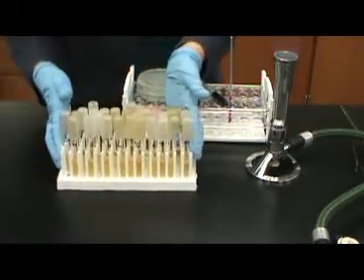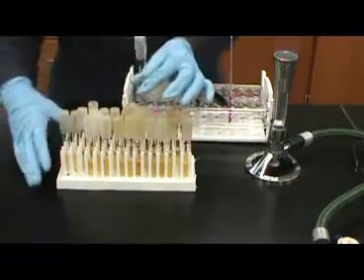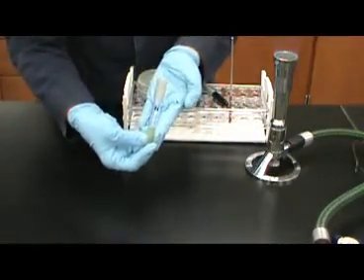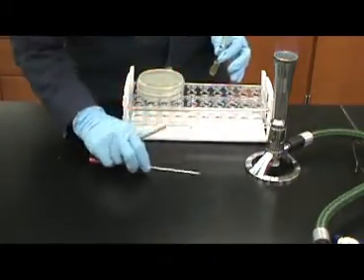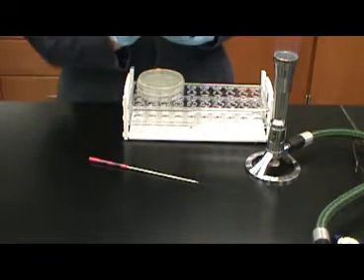You begin this process by selecting your unknown. The tube containing your unknown organisms should have two bacteria growing together. Once you've received your unknown organisms, be sure to label the tube with your name.